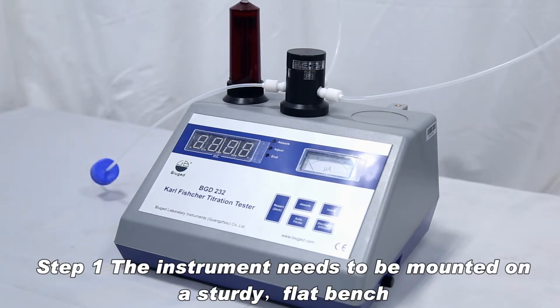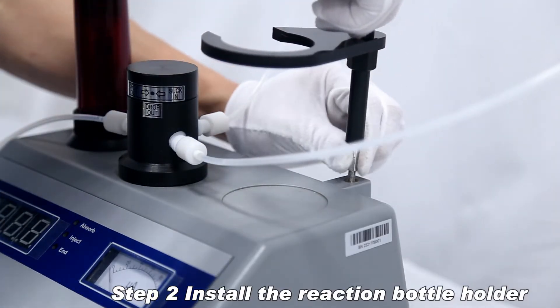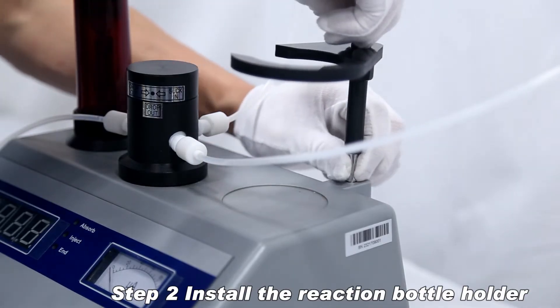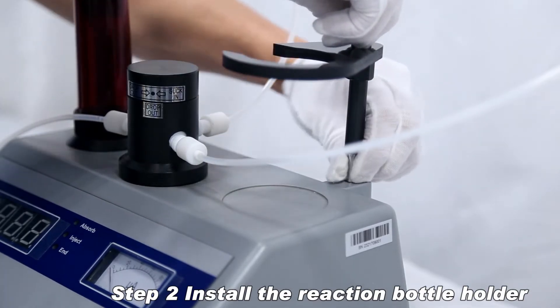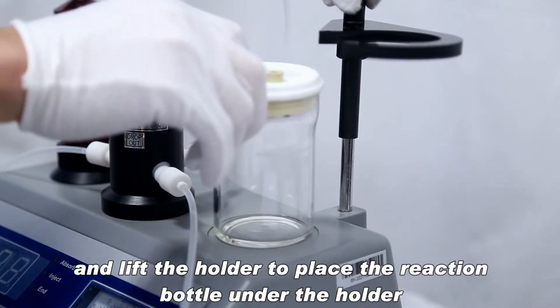The instrument needs to be mounted on a sturdy flat bench. Install the reaction bottle holder and lift the holder to place the reaction bottle under the holder.